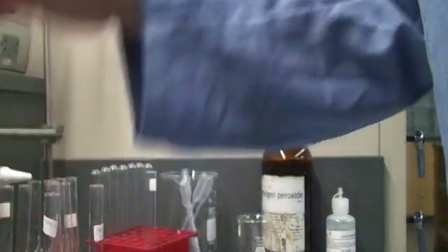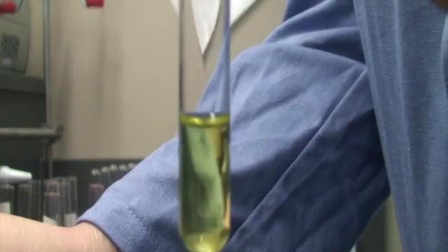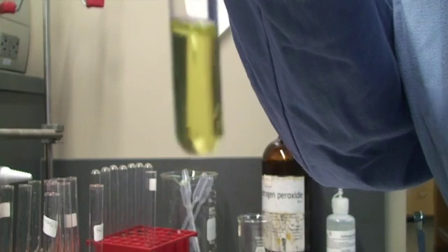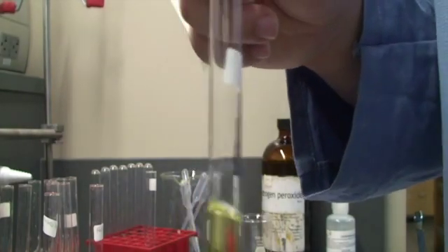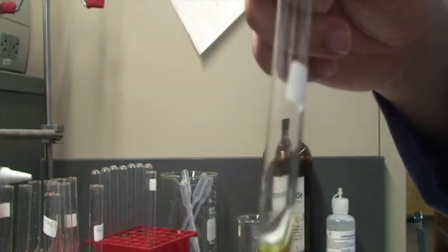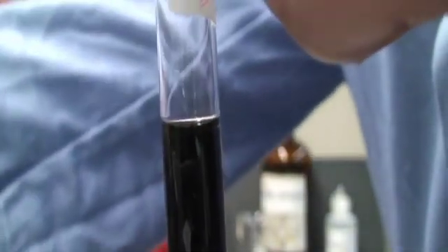Now I have another sample of iron(III) chloride — again the light yellow color. The first thing I'm going to do is add 10 drops of starch. You might remember from a previous experiment that starch reacts with iodine and it turns a very dark blue-black color. So once again, just like in the previous part, I'm going to add 2 milliliters of KI. You see that the KI changed it from a light yellow to now a dark blue color, which indicates the presence of iodine.